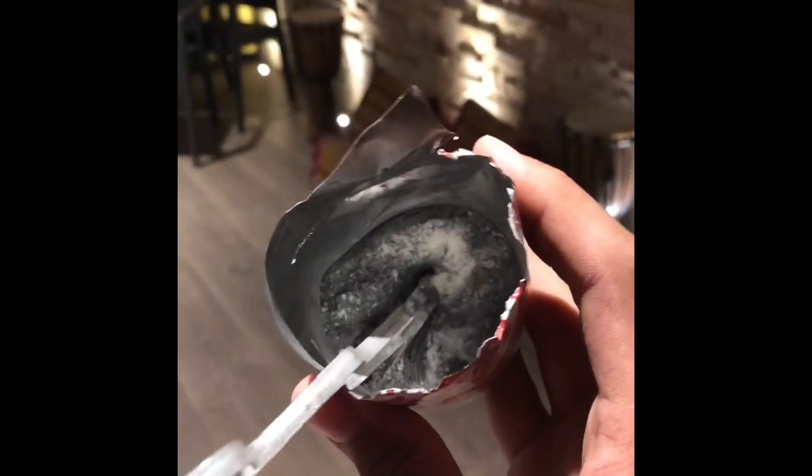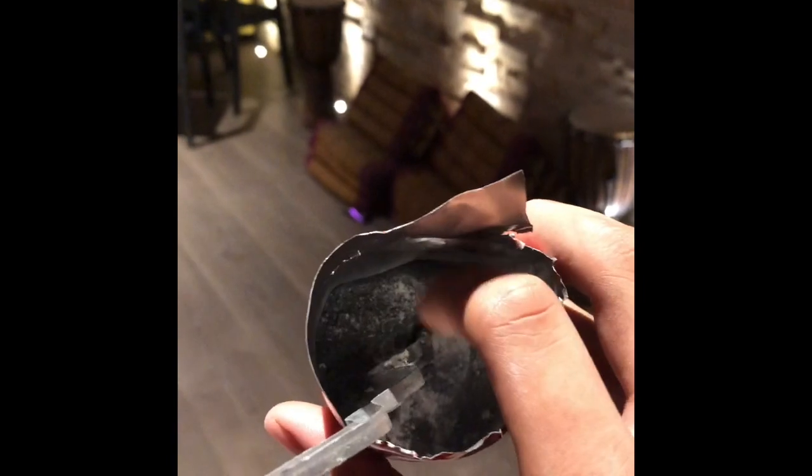This isn't a very good fuse, but you need magnesium because it burns at a very high temperature, and that's the reason I'm using it as the fuse. Because if you can't tell what I have here - ignoring the white powder, that's just random sand - the black stuff is not gunpowder, something in my opinion way deadlier. It's copper oxide.